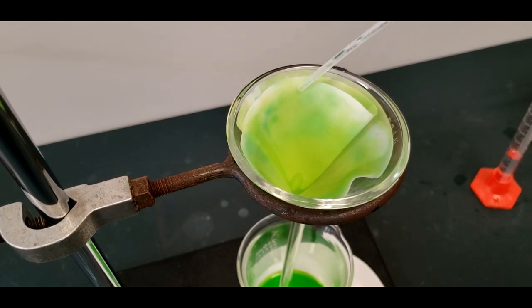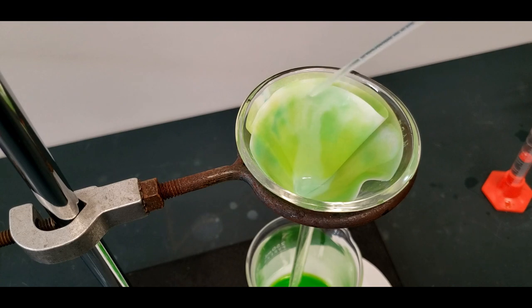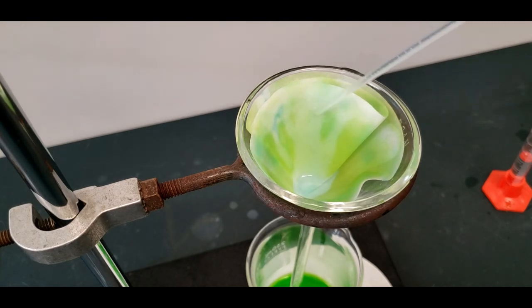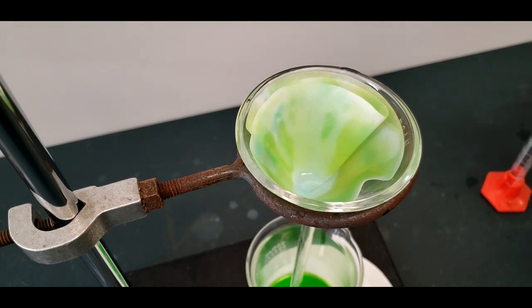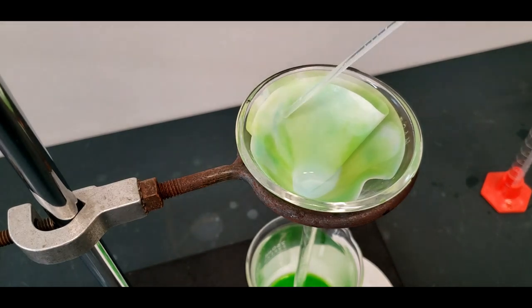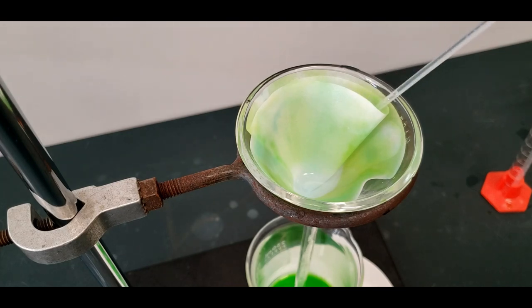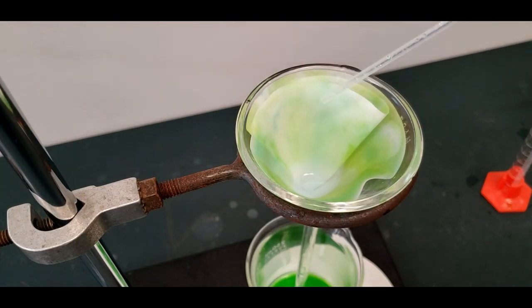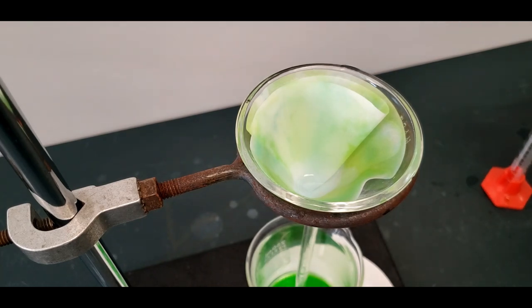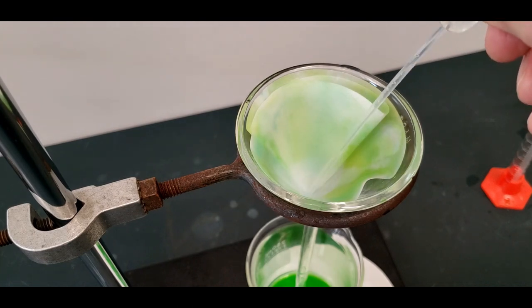We want to get as much of this copper off as we can. So I'm going to just use distilled water, because copper two chloride is extremely soluble. So it shouldn't take too much. Just what you don't want to do is pour a gallon of water through here. It will dilute things. So you want to put through the least amount of water that will get you most of the green color off. When I get done here, this will be about two mils that I'll have added. I'm being pretty careful. It doesn't have to be absolutely free of the green color, though some students are able to do that with the minimum of water. They're very careful.